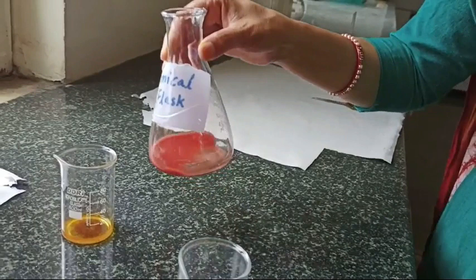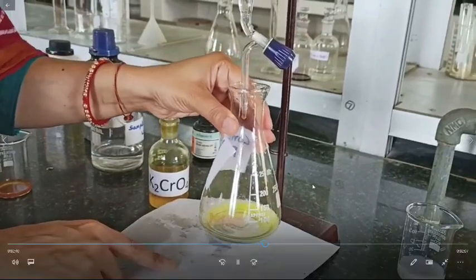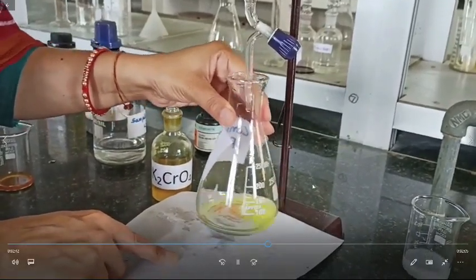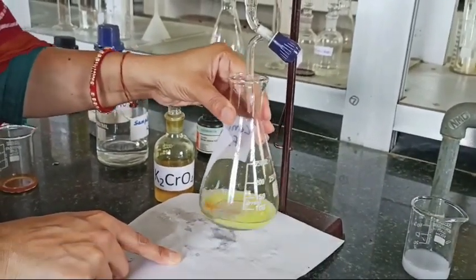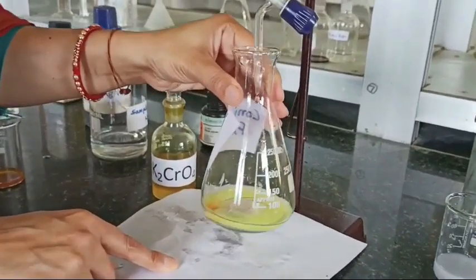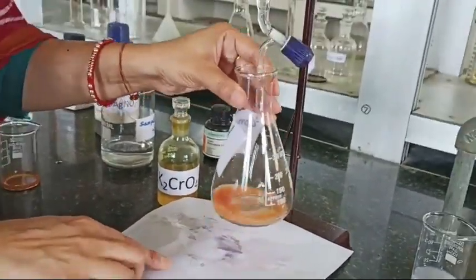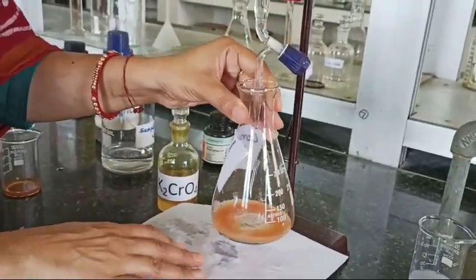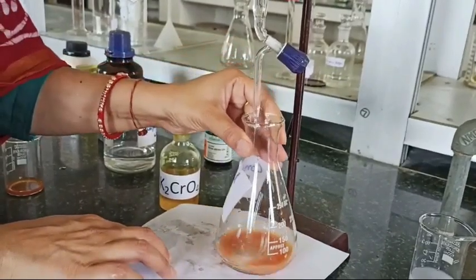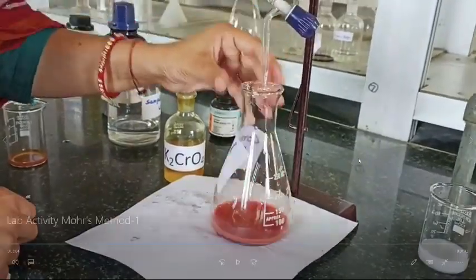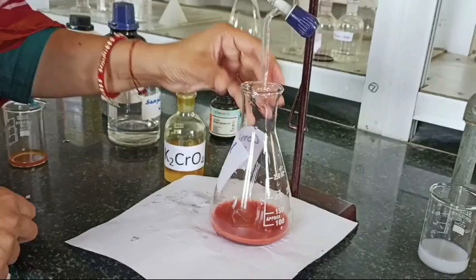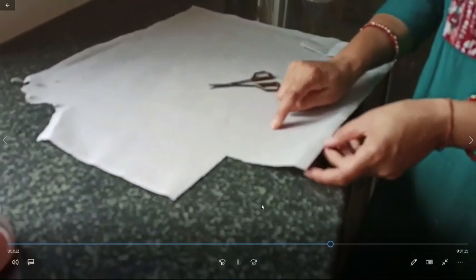If you see here this is changing the color at the bottom. So till it is changing the color at the center, it is more darker, so we have to watch it very carefully at the center of this conical flask. Here it stops changing the color.